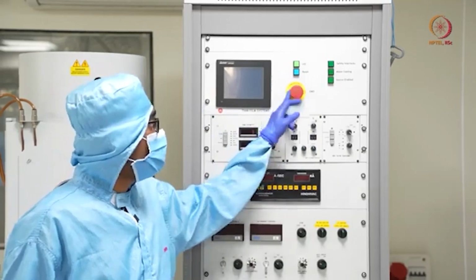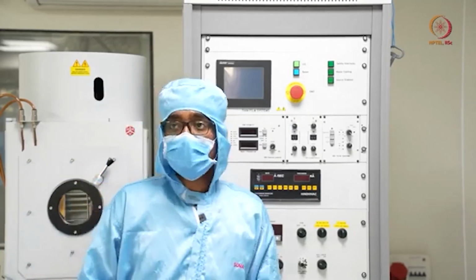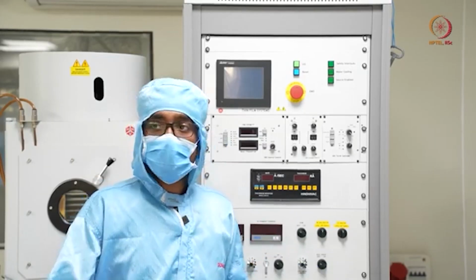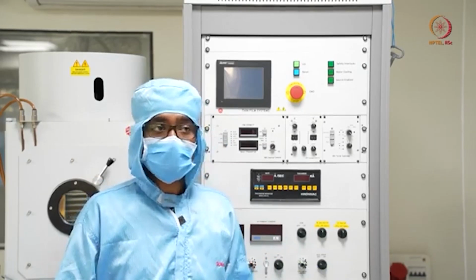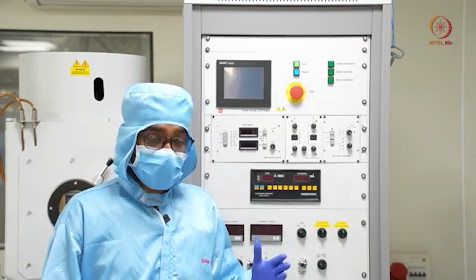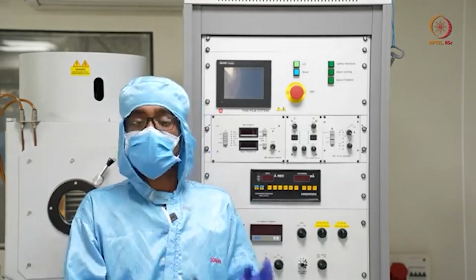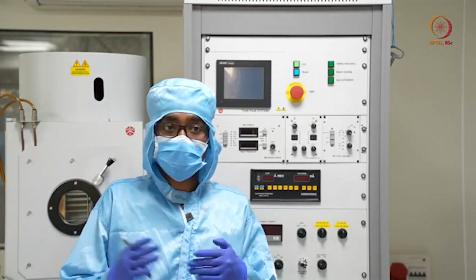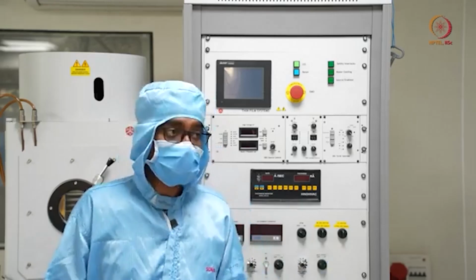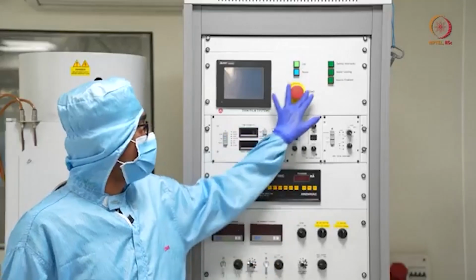Why I am telling this is very important, because if there is an emergency situation, like maybe a sudden power cut, or some fire or some other hazard comes, or maybe some chemical hazard imposed by someone else or happened because of some other tool, and you have to leave the place immediately, then you can just press the emergency stop and leave. So that is the utility of this.